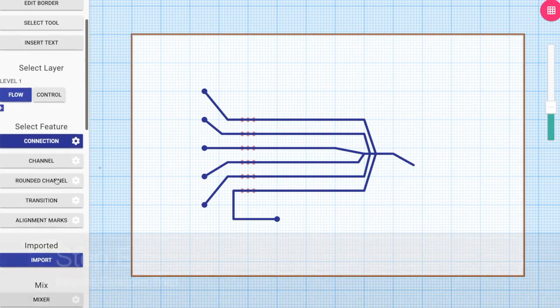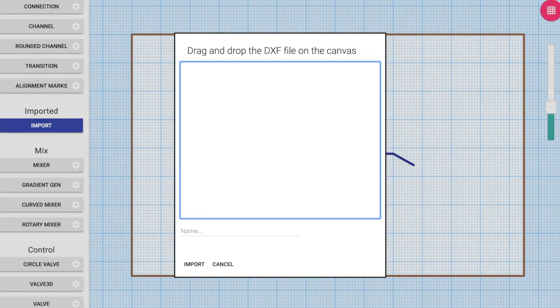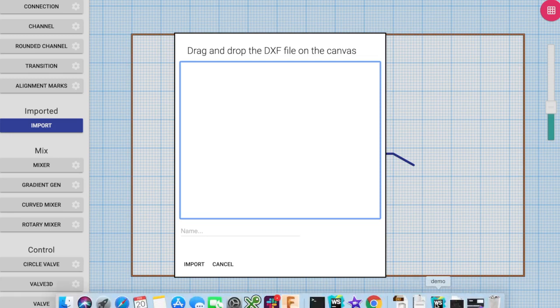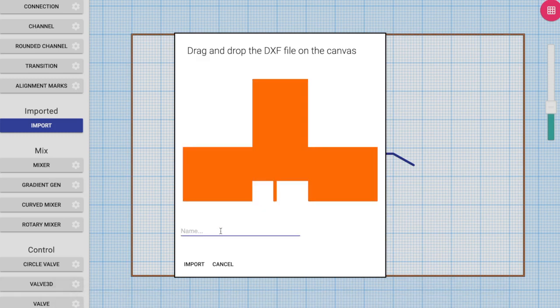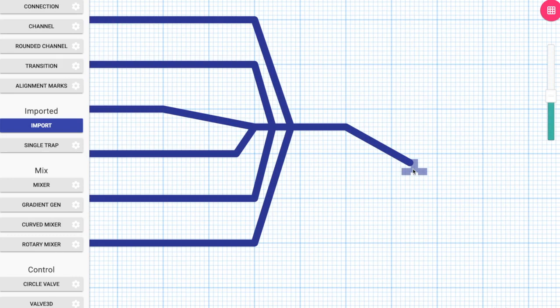So now we need a single cell trap, and it's a custom cell trap which is not part of our standard library. So I created a DXF design of this cell trap using Fusion 360. I import the DXF into 3DuF using the import functionality, and I call it a single trap. As soon as I do that, as you can see, the single trap popped up underneath the imported category. So I select the single cell trap and place a new single cell trap on the canvas.